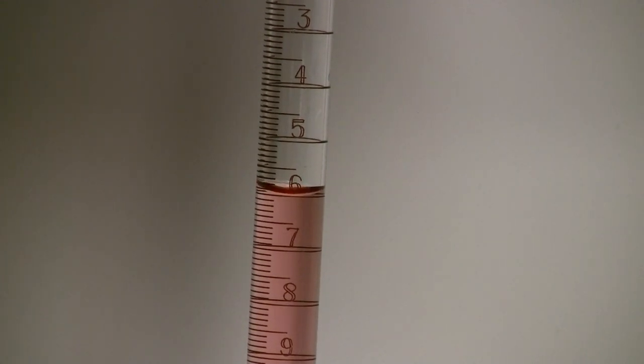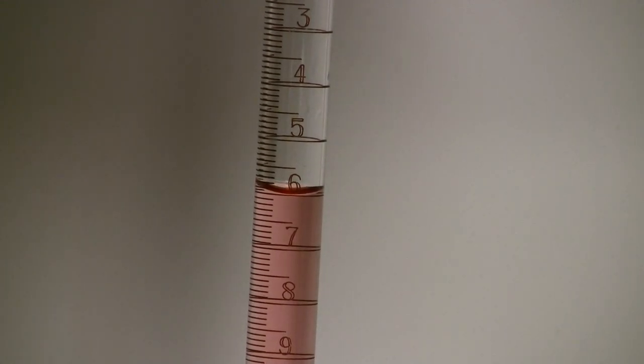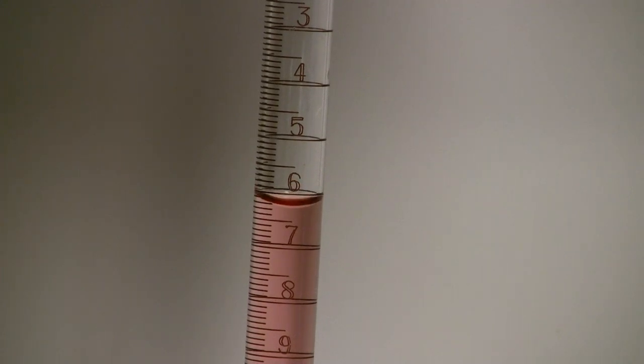Record your initial measurement to the hundredths place. Slowly release liquid into your receiving container until the desired amount has been dispensed.